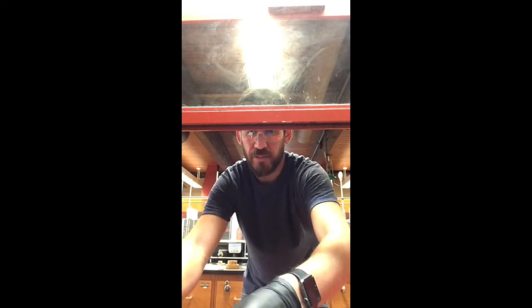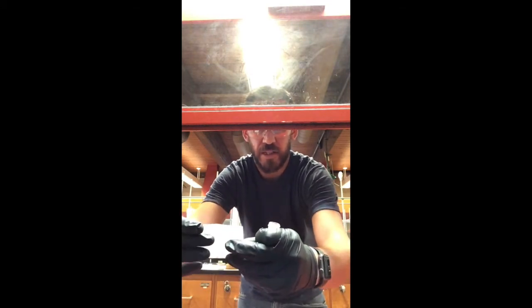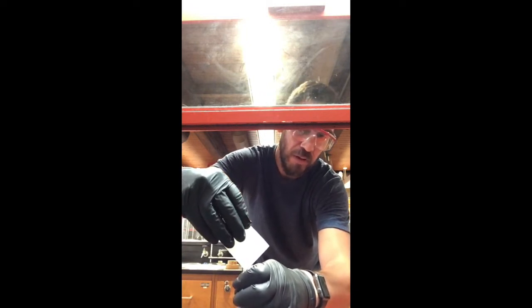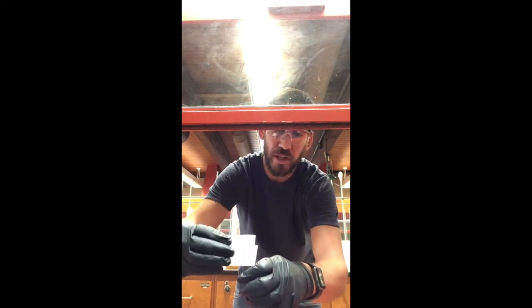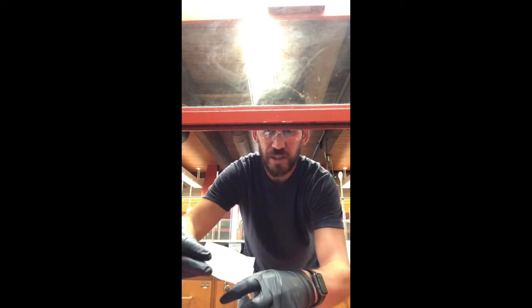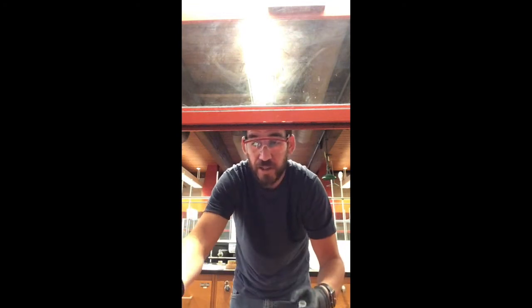We've got our 48 milligrams of benzoic acid. Place it in the conical vial. If you spill any you might have to restart because otherwise the distribution coefficient won't be calculated properly. Also make sure you don't leave anything behind on the weigh paper — these are definitely potential sources of error.